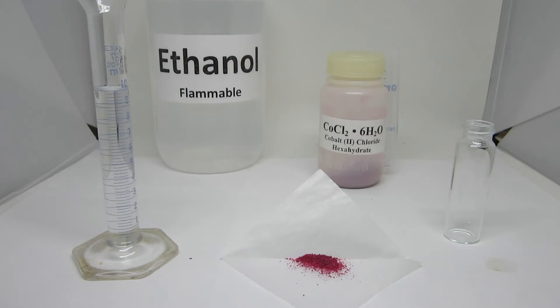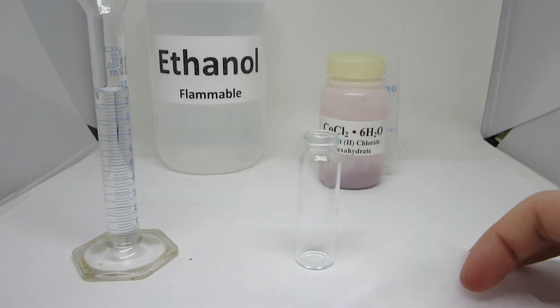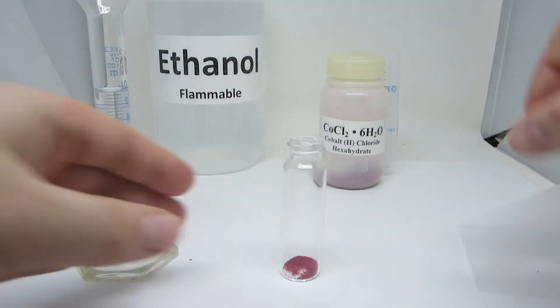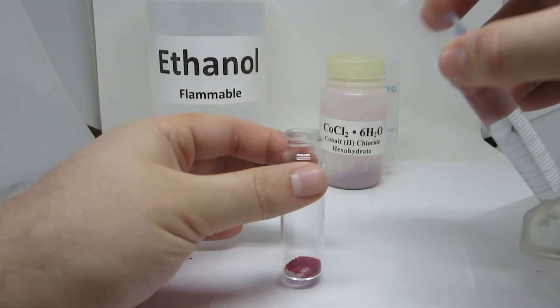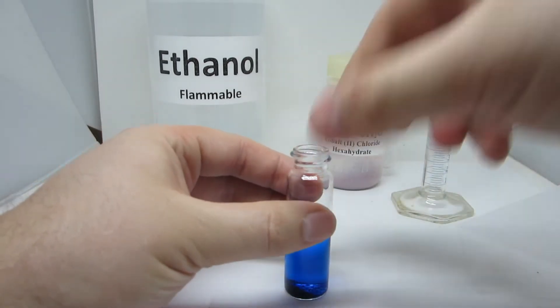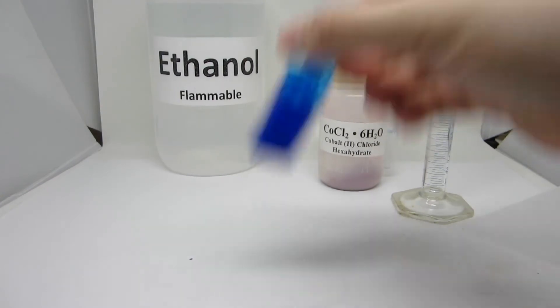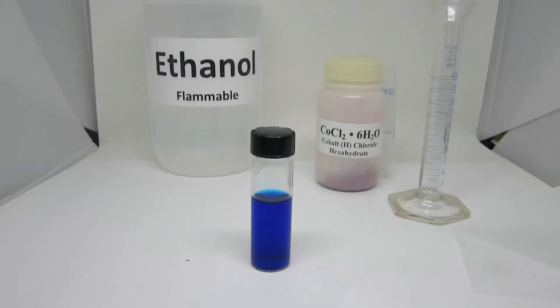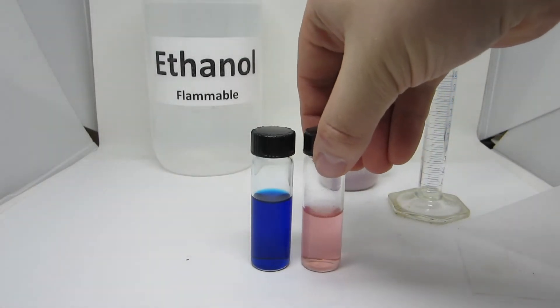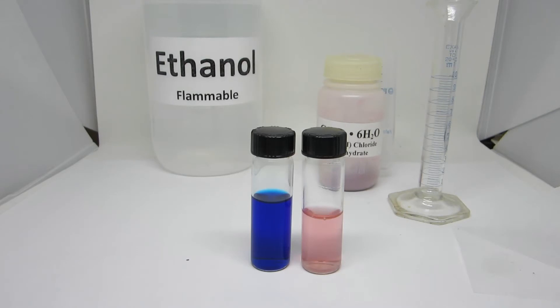The sample mass given in your unknown sample is first weighed out. After, this powder is dissolved in anhydrous ethanol, which contains no water. The red cobalt-chloride hexahydrate is dissolved in pure ethanol, resulting in a dark blue solution. This exact color is referencing the color known as cobalt blue, and it corresponds to the cobalt-tetrachloride complex. When comparing with the cobalt-hexa-aqua complex, which is red, it can be seen how important solvent selection is when performing a reaction.